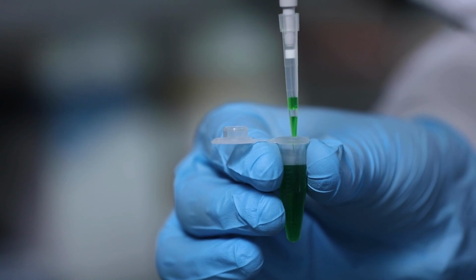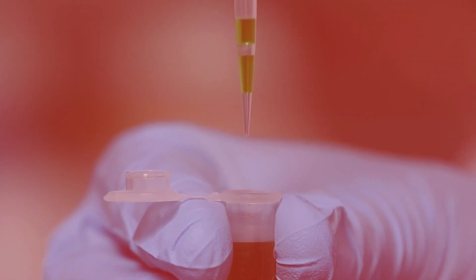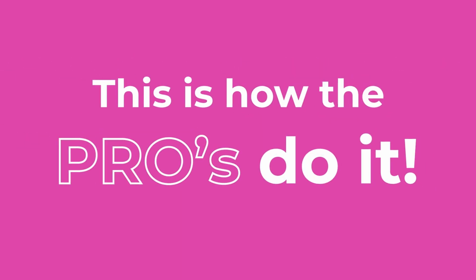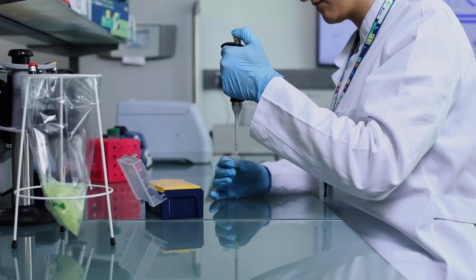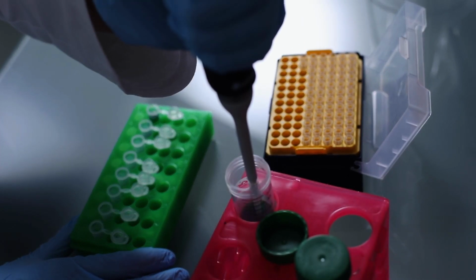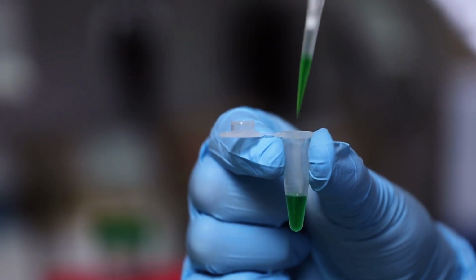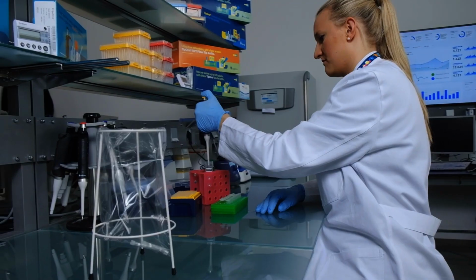Is it polite to blow bubbles in your drink when you're at the restaurant? It's not that much different in the lab. If you see bubbles forming in your tip like this, it might be time for us to have a chat about knowing how far you should go. Let's take a look at how the pros do it. There are two simple actions which influence accurate sample uptake when pipetting: the angle you are holding me at, and the depth the tip is immersed into the sample, so make sure to hold me vertically, otherwise too much liquid can be aspirated. The tip should be immersed enough to ensure you do not draw air into the tip, and allow the tip to fill fully before removing it from the sample. So remember, for accurate results, keep your pipette upright and know how far to go.